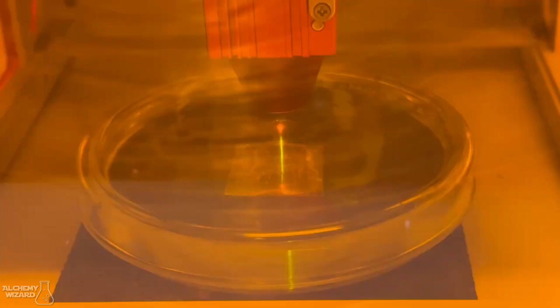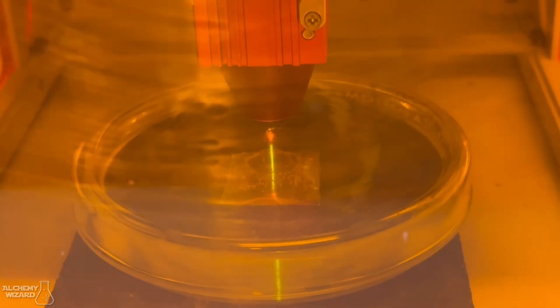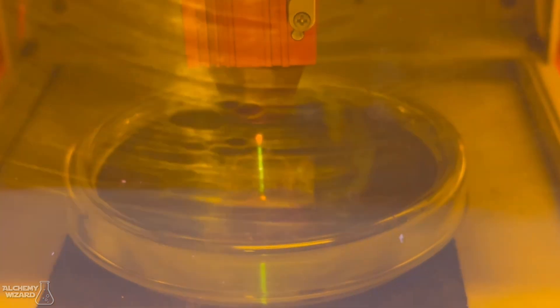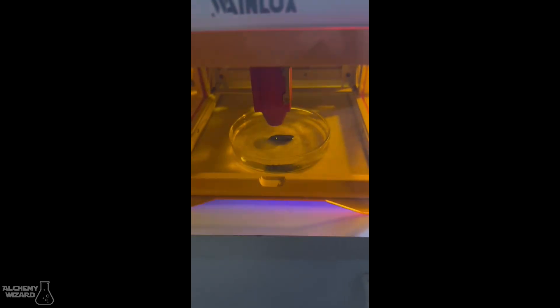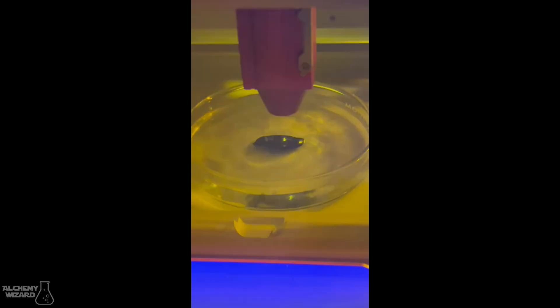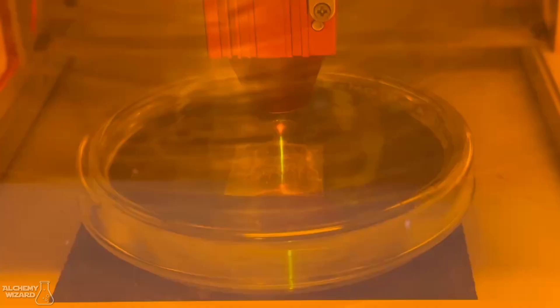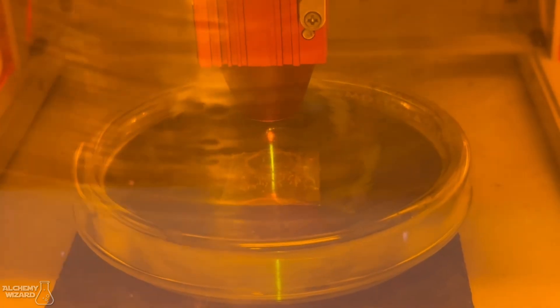It doesn't impede the progress at all, and what it does do is keep the water from evaporating too quickly because the laser has a fan on it, blows down into here and it tends to evaporate the water very fast. And distilled water, well you know it takes time to make distilled water and keep adding it. The petri dish cover keeps it all enclosed.